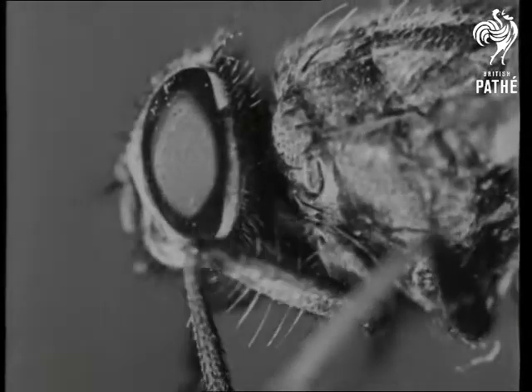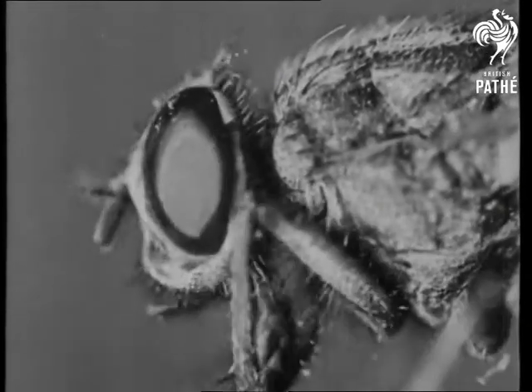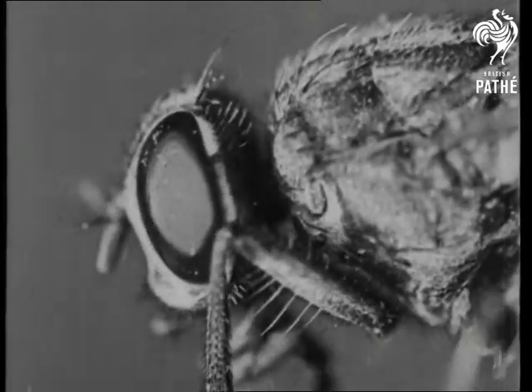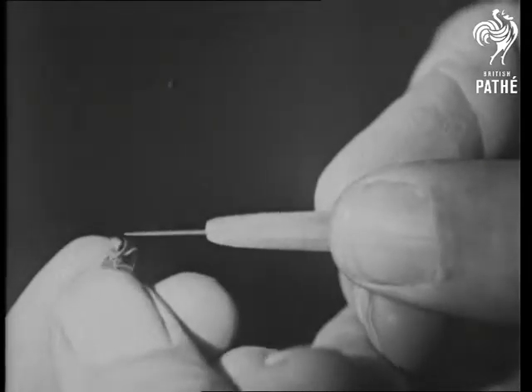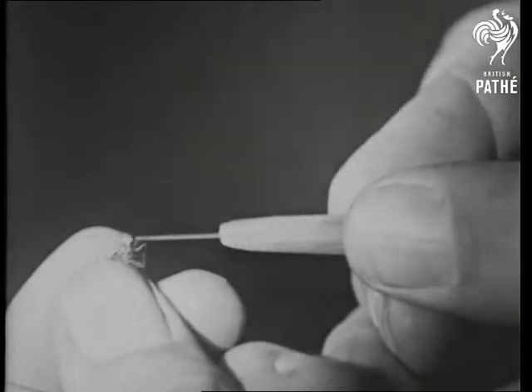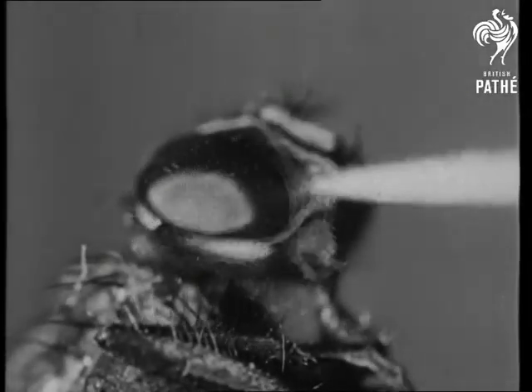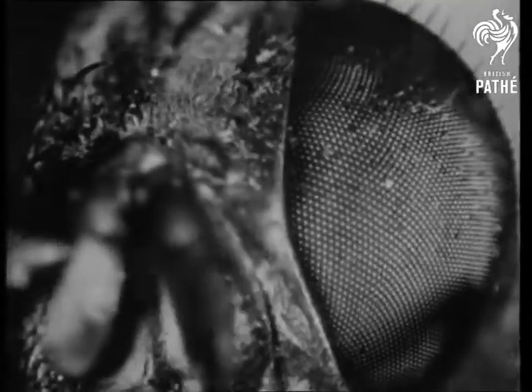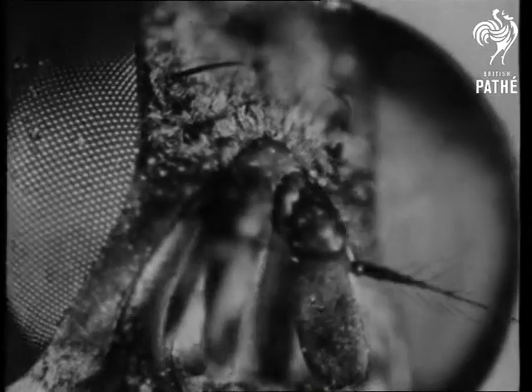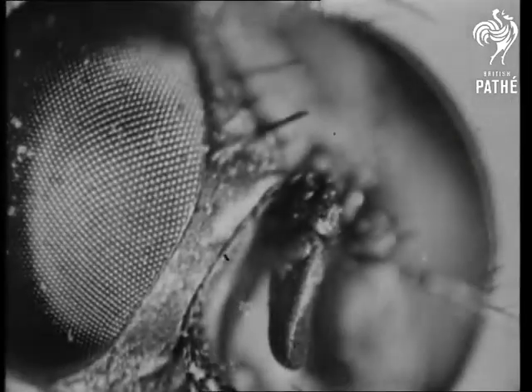We can tell you a lot of interesting things about the common house fly. For instance, like all insects, he has six legs. And again in common with all insects, he has what are called compound eyes. Instead of a single lens, each eye has thousands of lenses or facets pointing in every direction. This full face portrait makes us realise why it's difficult to sneak up with a fly swatter and catch him unawares. Very little goes on that the fly doesn't see.